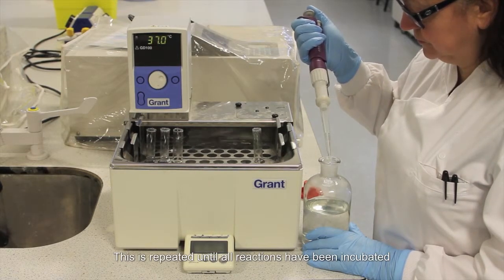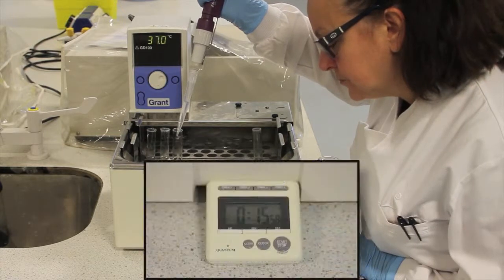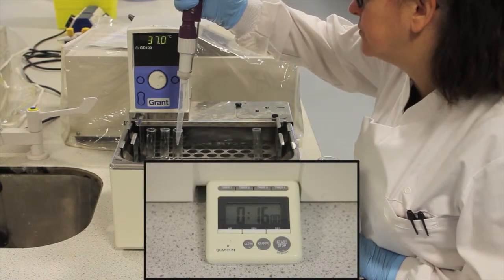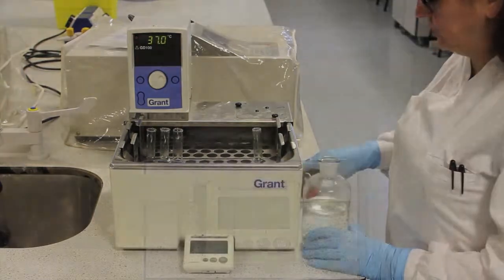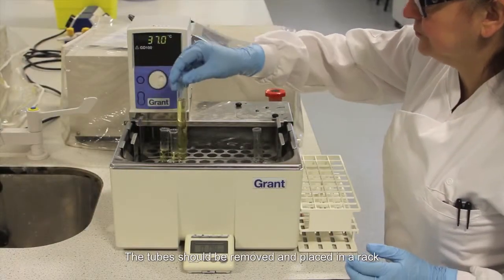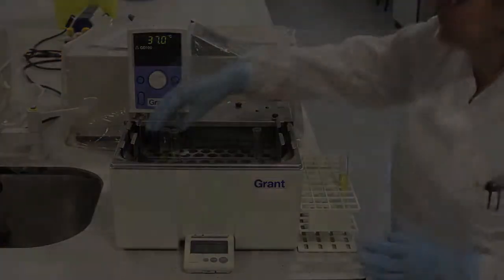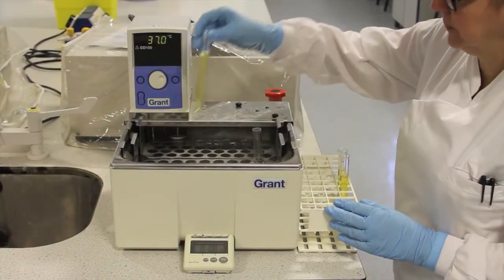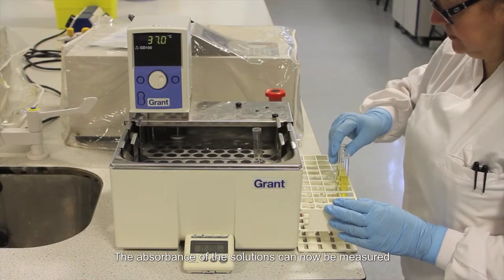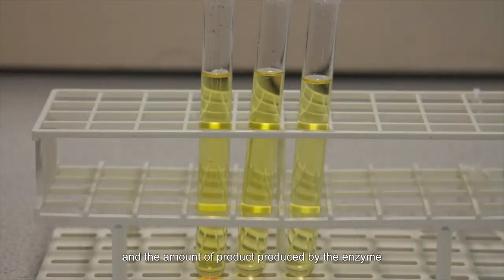This is repeated until all reactions have been incubated for the correct amount of time. The tube should be removed and placed in a rack. The absorbance of the solutions can now be measured, and the amount of product produced by the enzyme is determined using a calibration graph.